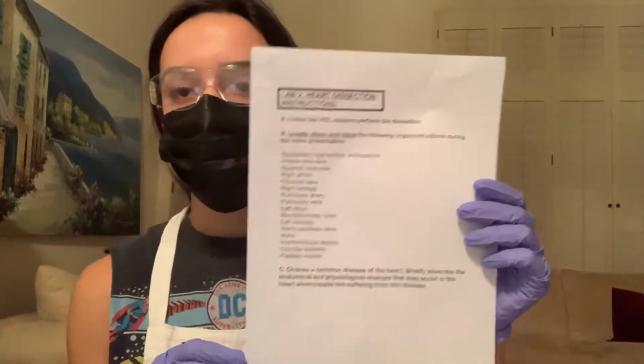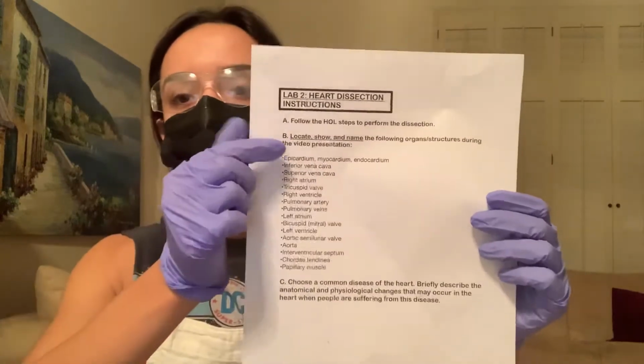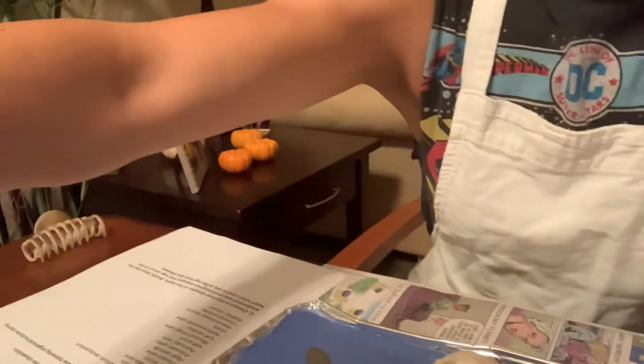This is the back of my paper. The other paper I will be referring to is this one over here, and this just lists the directions and every structure I'll need to be talking about. And this is the back of the paper. Let's see. That is the direction. So if I'm looking down in that direction, that's what I'm looking at.